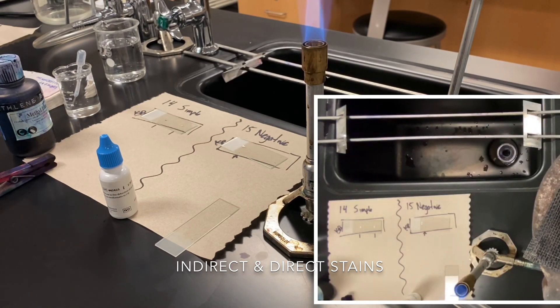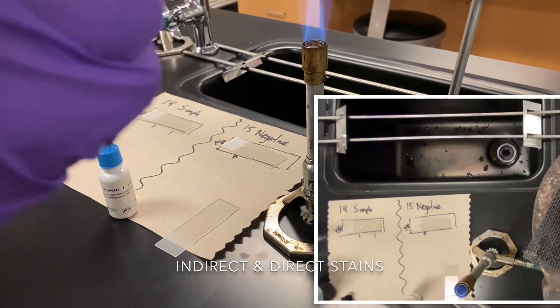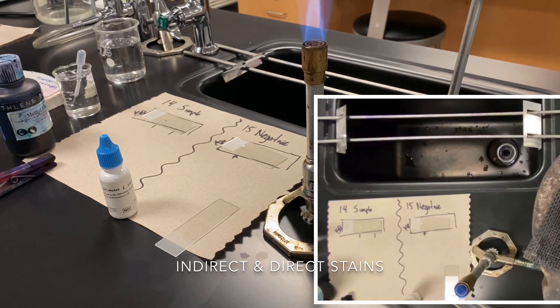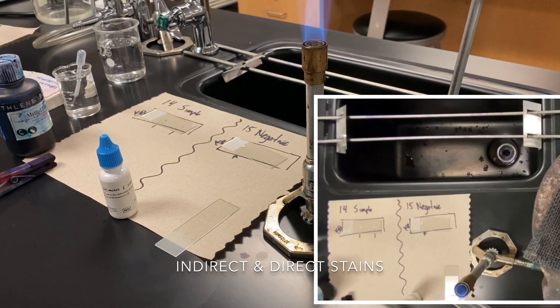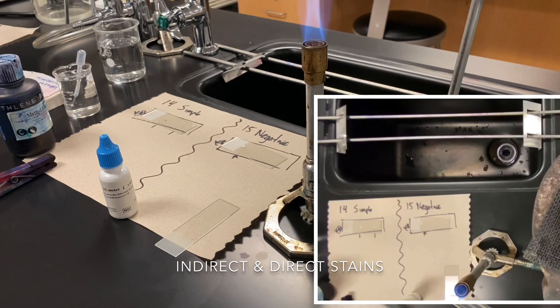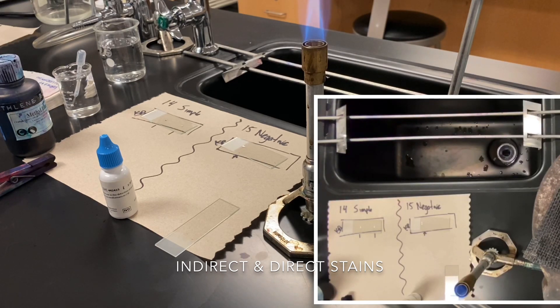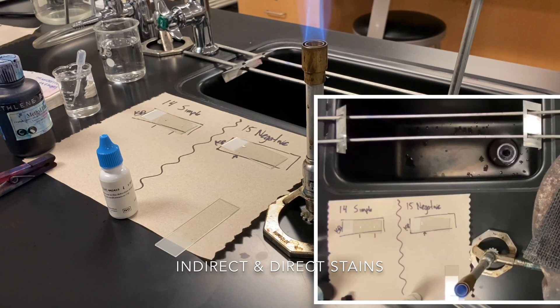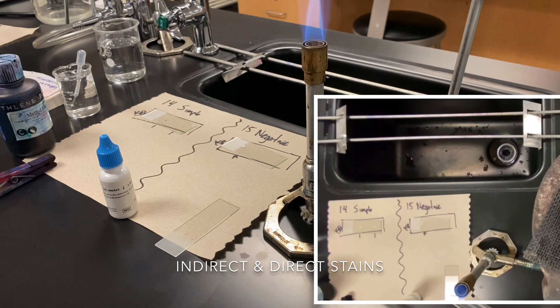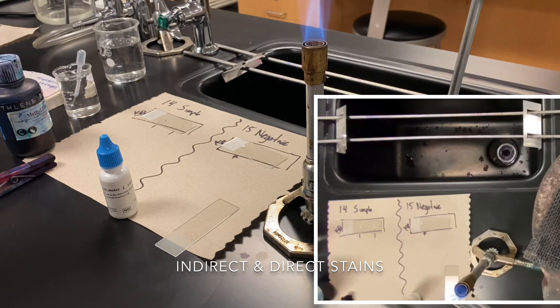We're going to aseptically transfer the organism into both slides. The reason we do this aseptically, even when it's not strictly required, is because other people may be using your sample and you don't want to contaminate it for them. So we maintain aseptic technique regardless.